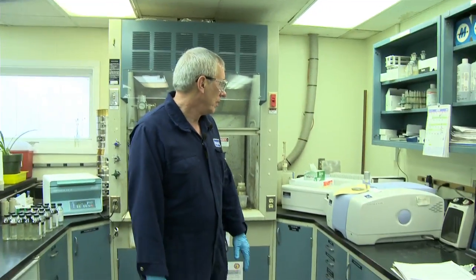Next, we'll have some of our lab staff, Mr. Tim Finley and Mr. Tim Fitzgibbon, as well as Heidi, talk a little bit about their specific areas and their instrumentation and explain a little bit about how that works. So my name is Tim Finley. I'm a chemist here in the lab, and I do a variety of things. I used to work in the crude section. I worked in the ICP, and then now I'm doing all this other stuff.